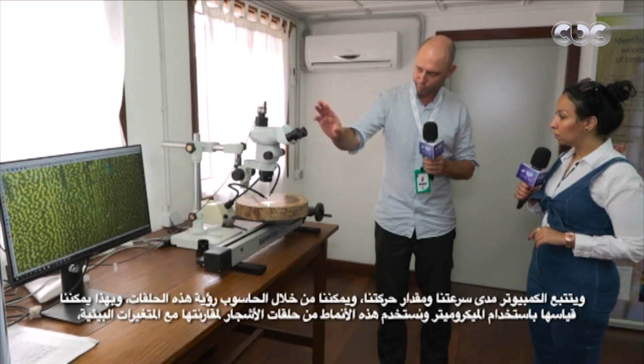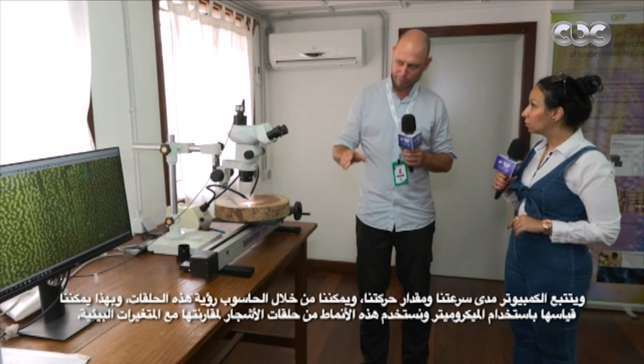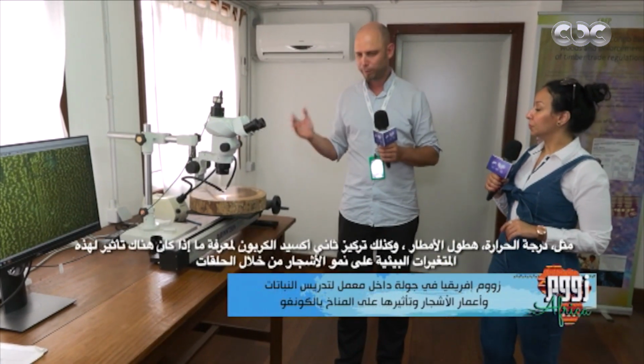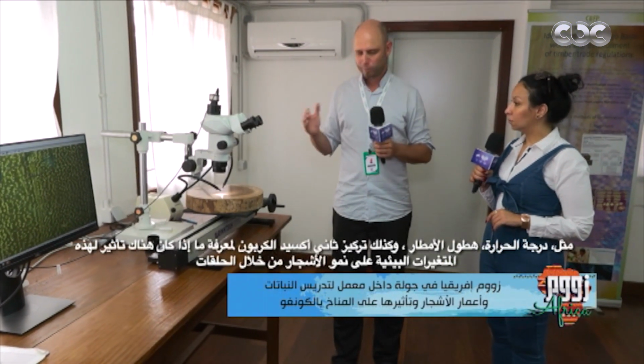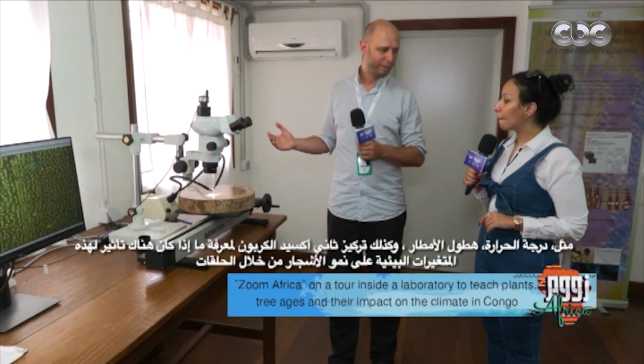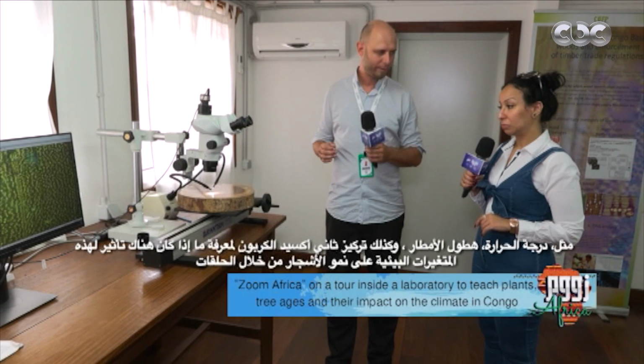And we can indicate on the computer each time we see a growth ring, and the growth rings are being measured automatically, down to the micrometer. We use these patterns of tree ring widths to compare with environmental variables, for example temperature, precipitation, but also CO2 concentration, to see if there is an influence of these variables on the growth of trees.